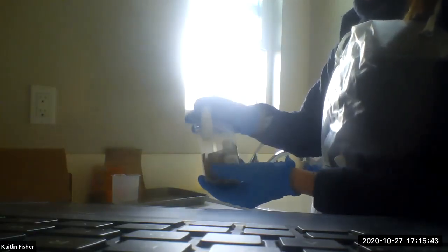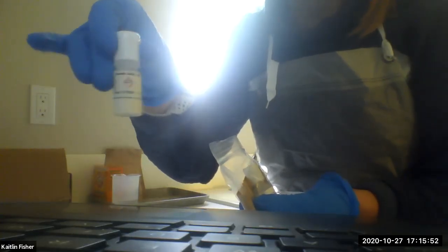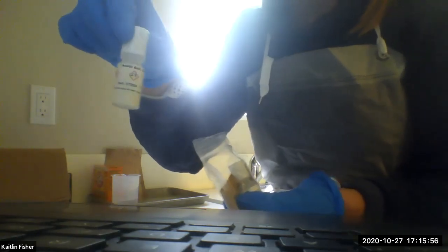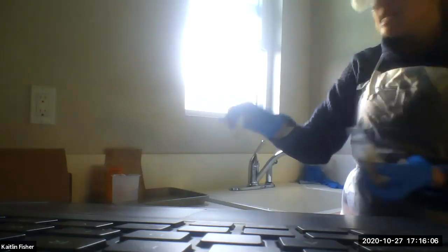We also have in here our acetic acid, and it says on the side 3M. This is very concentrated, a weak acid, but it is concentrated, so make sure you're careful in handling this. It'll have a little bit of a vinegary smell when you open it, but don't panic. It's not bad for you to smell it. It's essentially the same thing as a really strong vinegar. So, acetic acid.